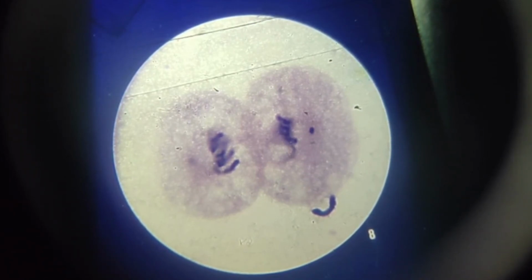You can thus see how mitosis in these slides achieves its function. One cell with 2 pairs of chromosomes forms 2 cells, each a duplicate of the original. In the human being, the process of mitosis is the same, but the number of chromosomes is 46 as compared with the 4 in these slides.